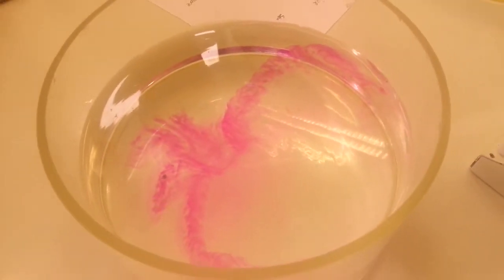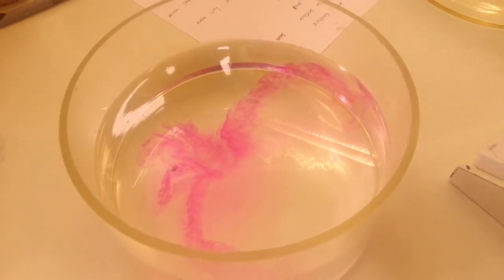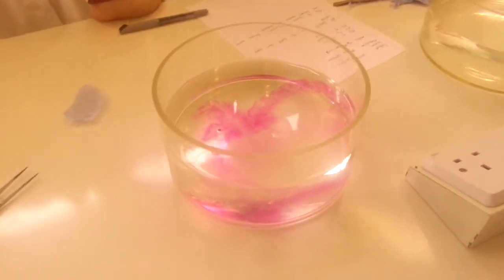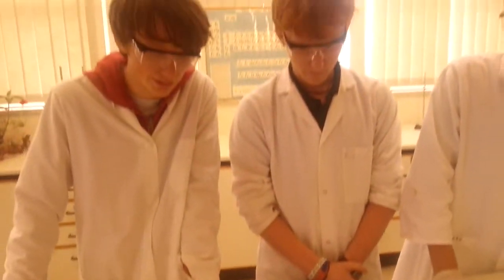Bouncing around. Oh, there's the smoke. And all through this it's producing hydrogen gas into the air. Still a little bit there.